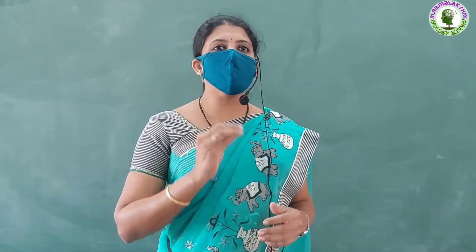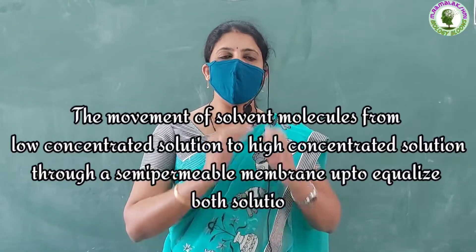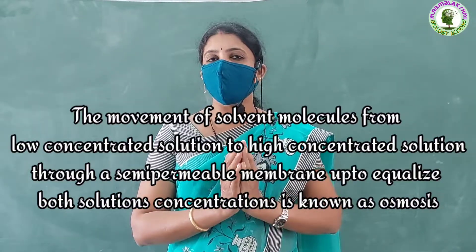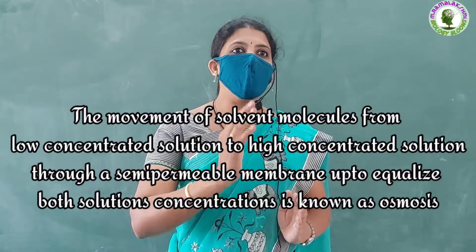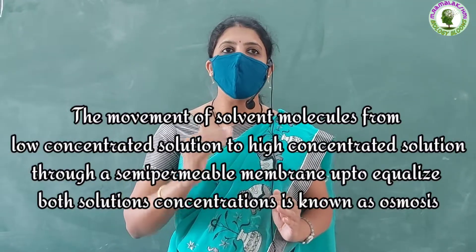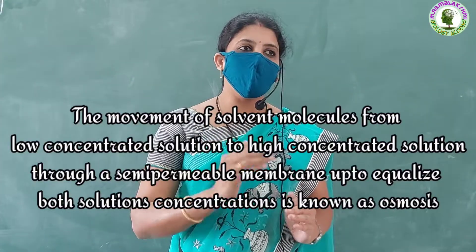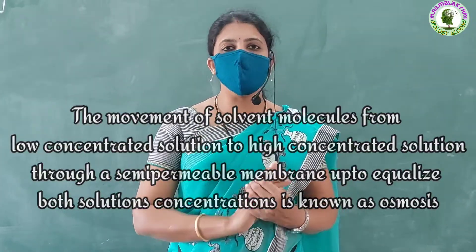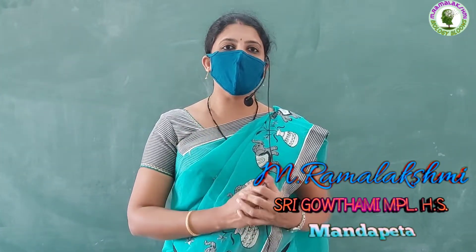Children, today we will discuss about osmosis. The movement of solvent molecules from low concentrated solution to high concentrated solution through a semi-permeable membrane, up to equalize both solutions' concentrations, is known as osmosis. To prove this, we will do an activity.